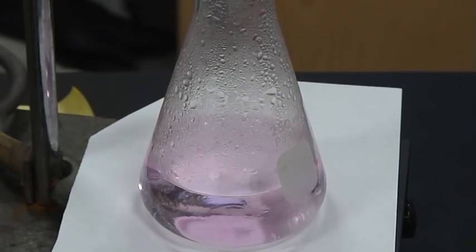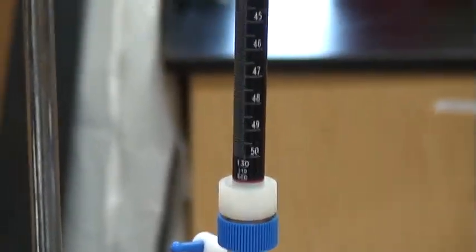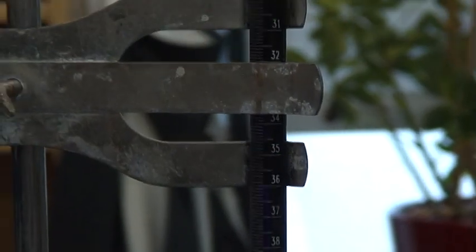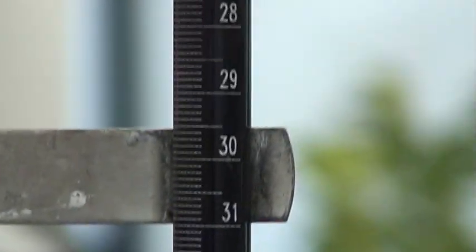Okay, so now we know that I'm at my equivalence point. I'm going to simply go and read my burette, and I want to go to tenths of milliliters, and so I'd actually go through and see where that was. The bar is actually covering up, so I go there, and remember I didn't start at 0, so I needed to record from the very top where my starting point was, and I need to subtract that from this as well. Okay, so that's all you need to do for this.